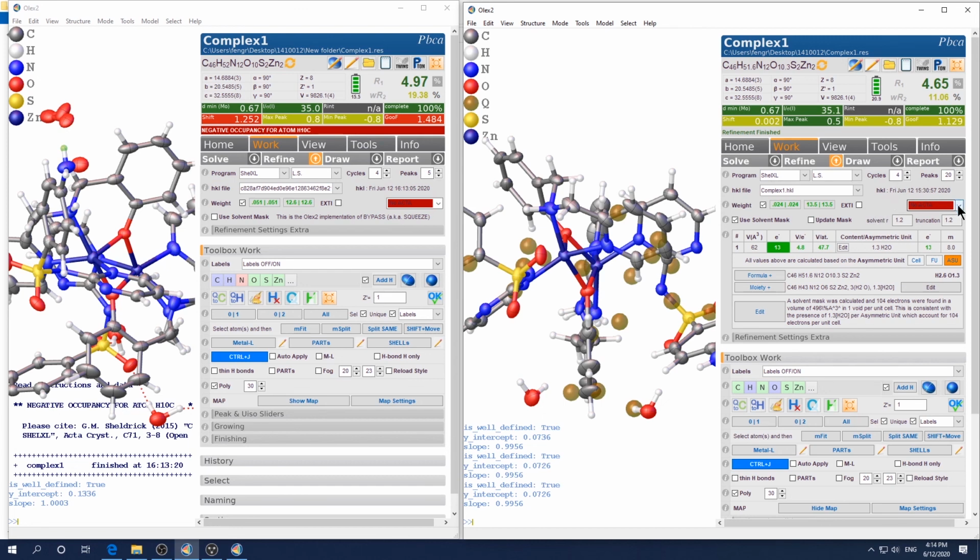Last word, so if you want to prepare your own CIF file, just go here and choose ACTA and click refine. That will write a new copy of that file, which is now the HKL file or RES file. All the necessary files are embedded correctly. That's one advantage of the Olex2 program.